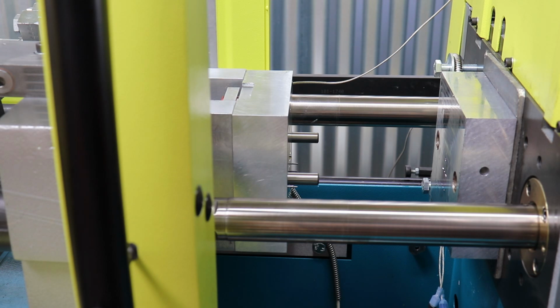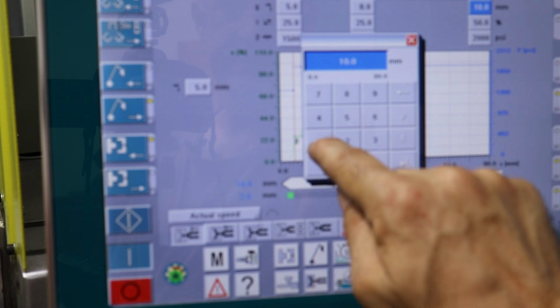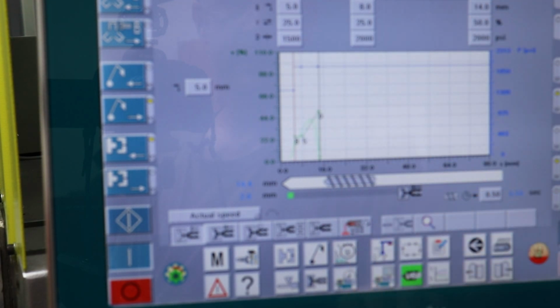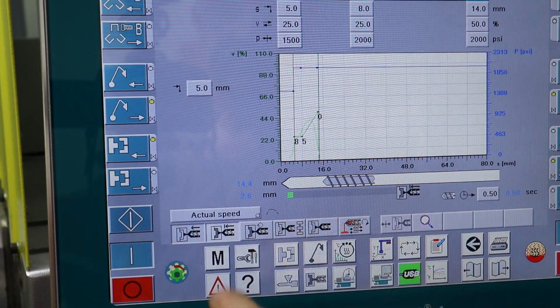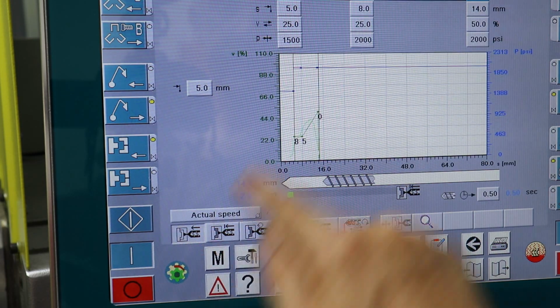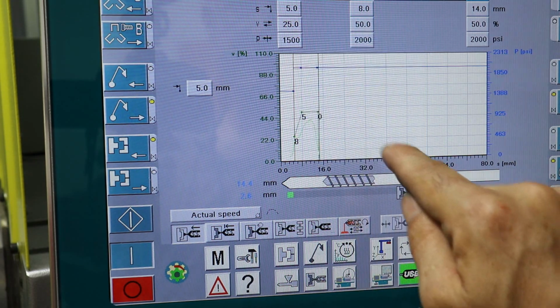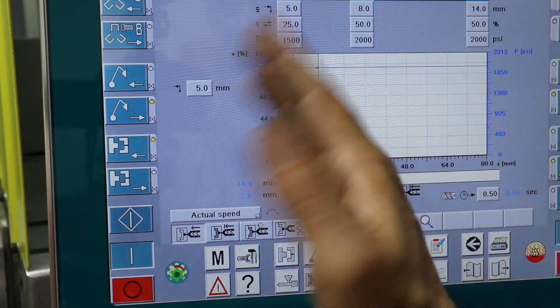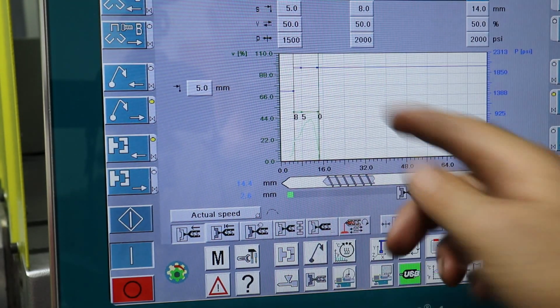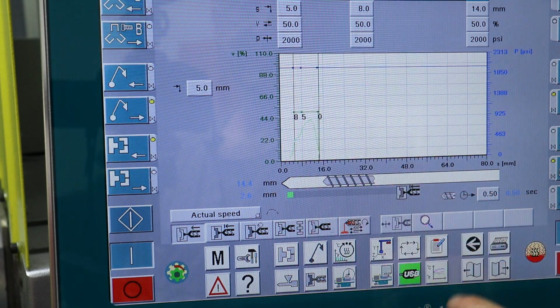So over here on the control, I think the first thing we need to do is increase the shot size to like 14, where right now it's 10 millimeters. And I am also going to increase the velocity of injection to 50%. So this page defines how the plastic is shuttled into the mold, so its velocity and pressure. We'll increase the pressure to 2,000.